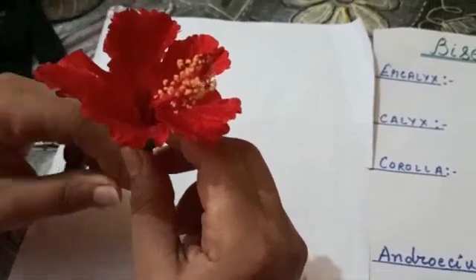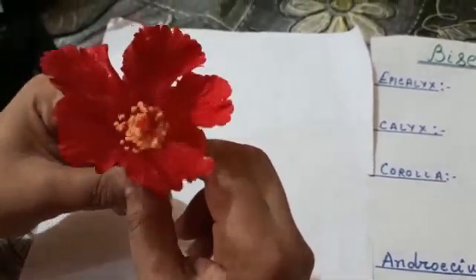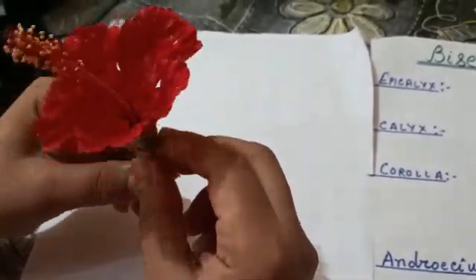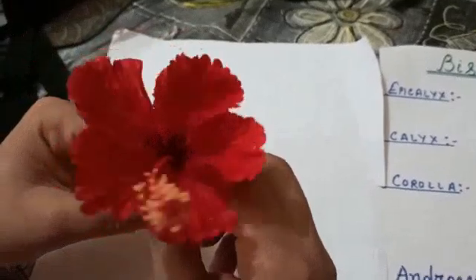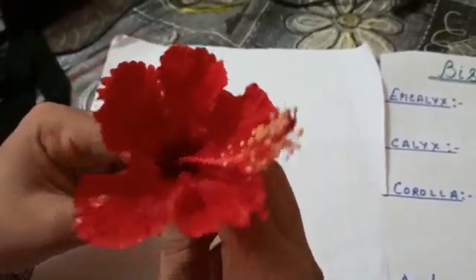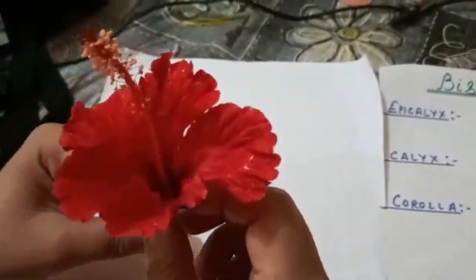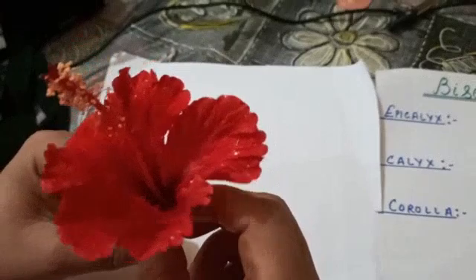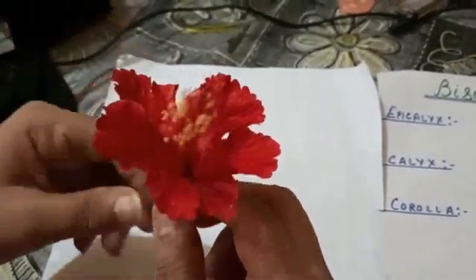Hello everyone, I'm going to explain the structure of a bisexual flower. In my hand is a China rose — its scientific name is Hibiscus rosa-sinensis, and in Hindi it is known as Gudhal. I'm going to show you all the different parts of this flower.